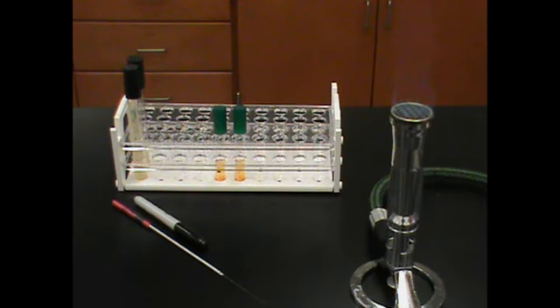Urease production is found primarily in gram-negative enteric bacteria. Many of those enterics are known causative agents of urinary tract infections, since urea is the primary nitrogenous waste found in urine. The urease test is also used to differentiate Proteus, which is a rapid urease producer, from other gram-negative enteric organisms.